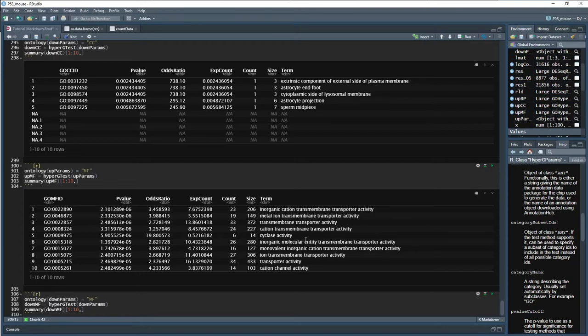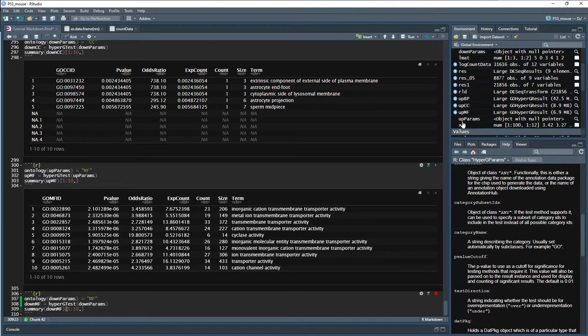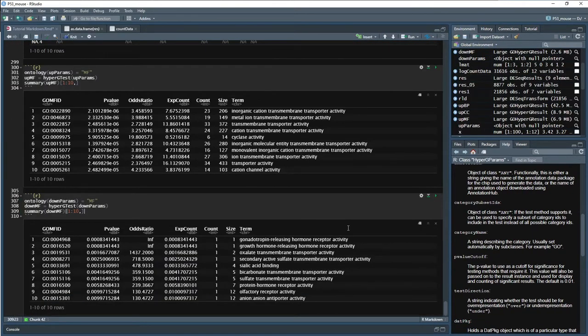Okay, so here we see some transporters. So P53 is gonna help trigger some of that stopping of cell growth. So that could be an indication of that. Go ahead and run this last one. Down doesn't have as much to work with. It's only 7. And here looks like there's some receptor that's still growing, a growth factor receptor. Without diving too much into this, that kind of makes sense. Cell keeps wanting to grow. That wouldn't be present in up here where the cell is arresting growth.